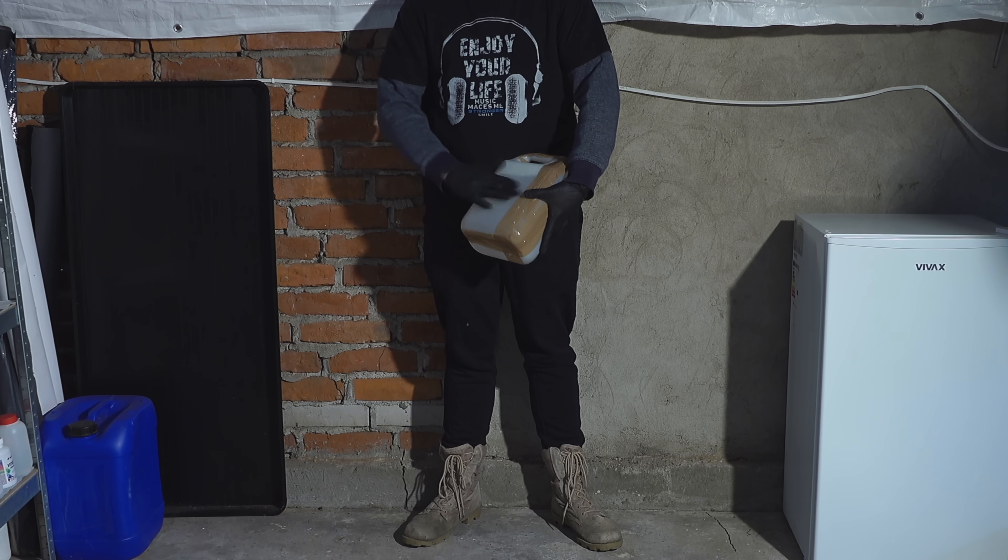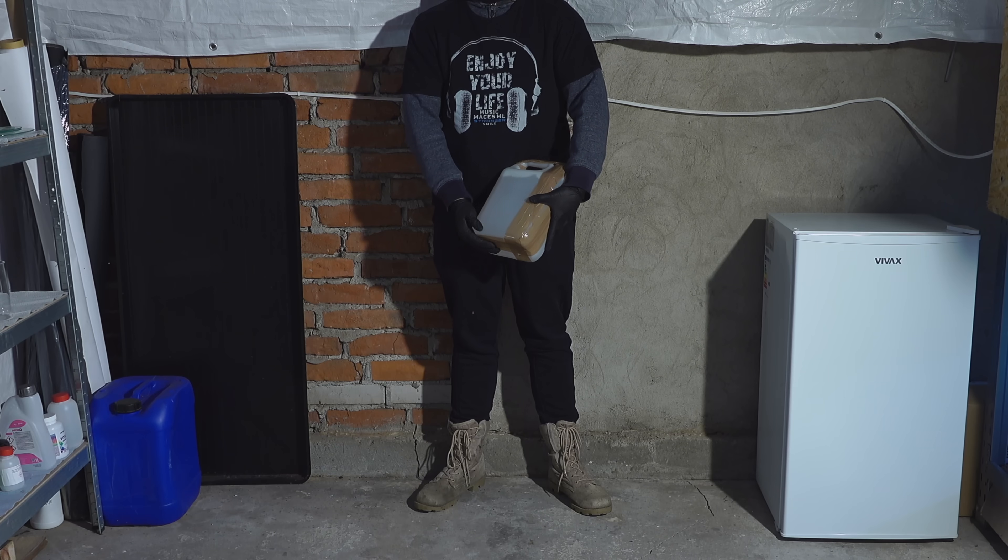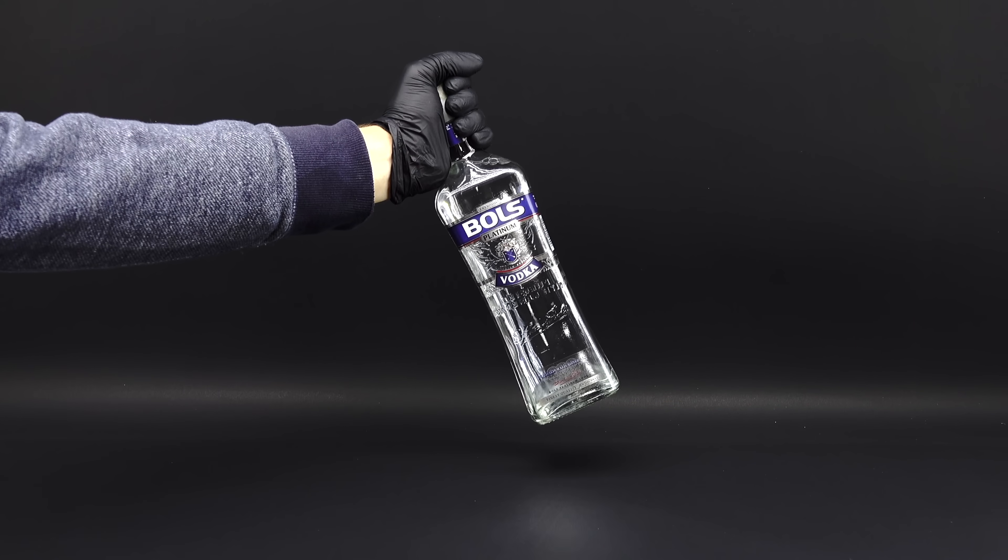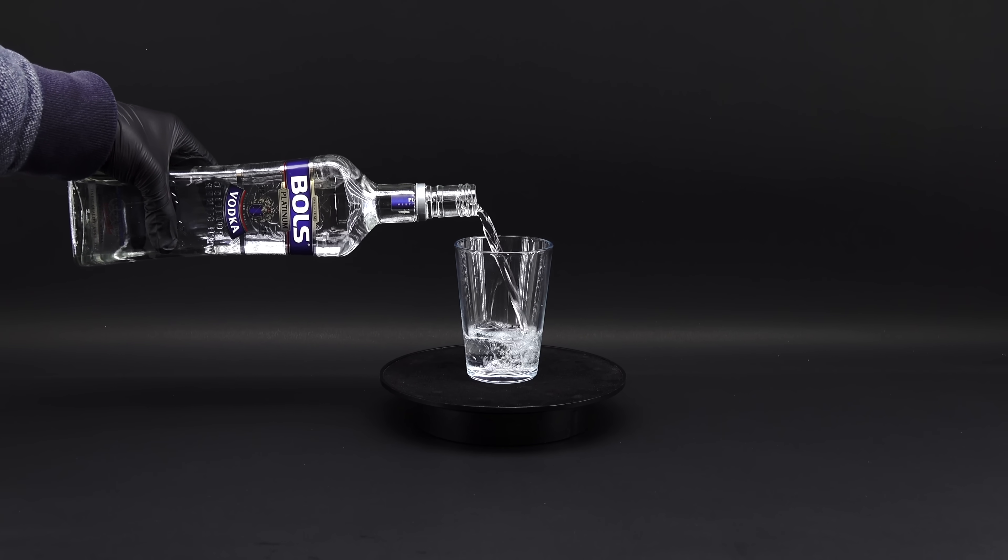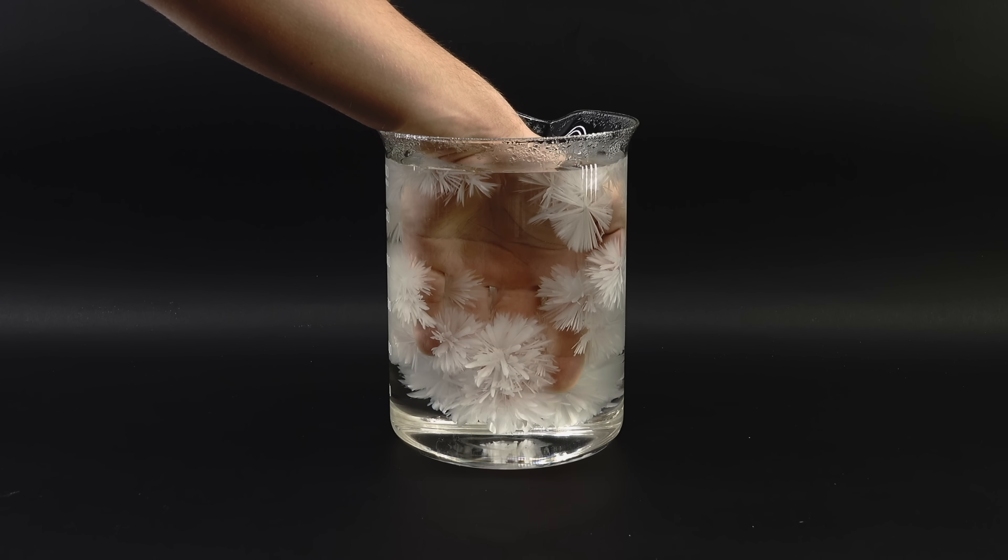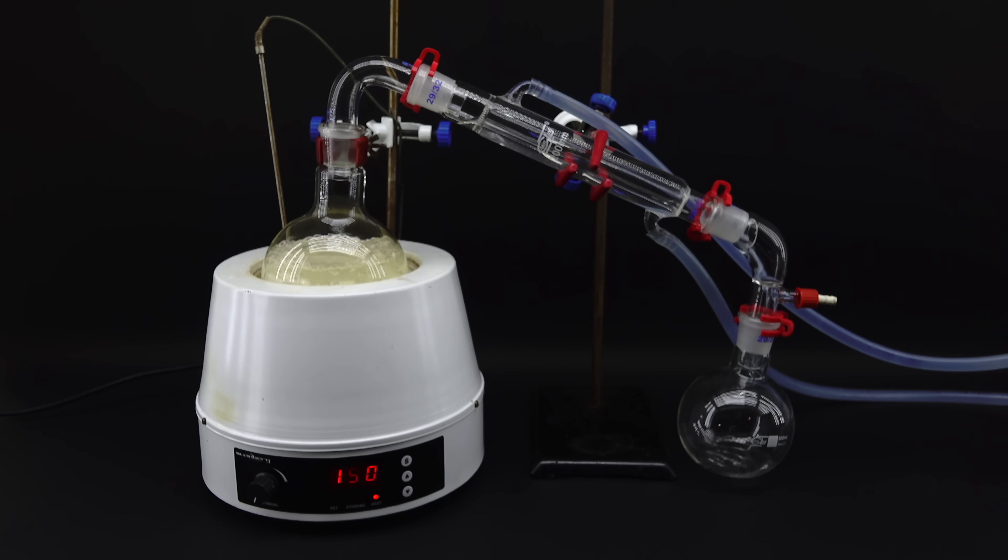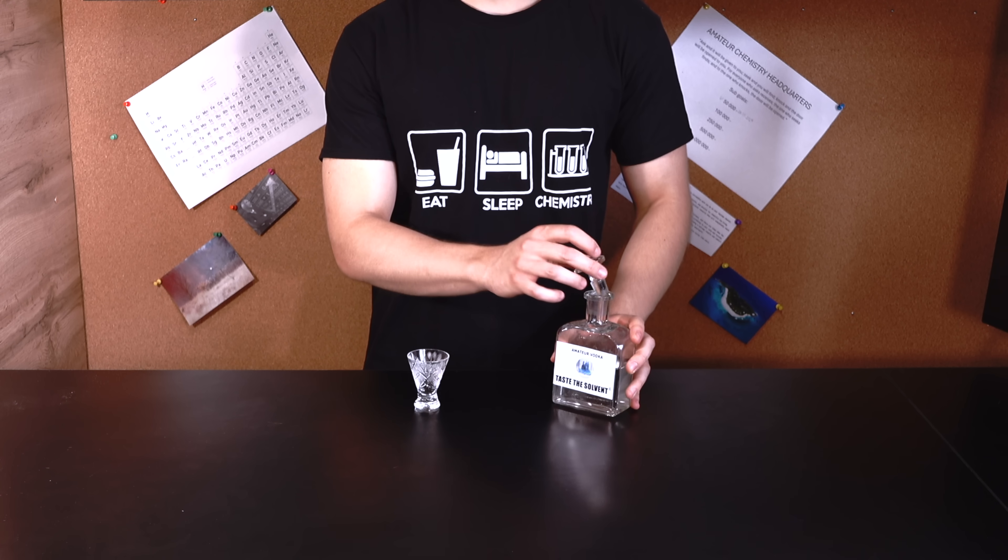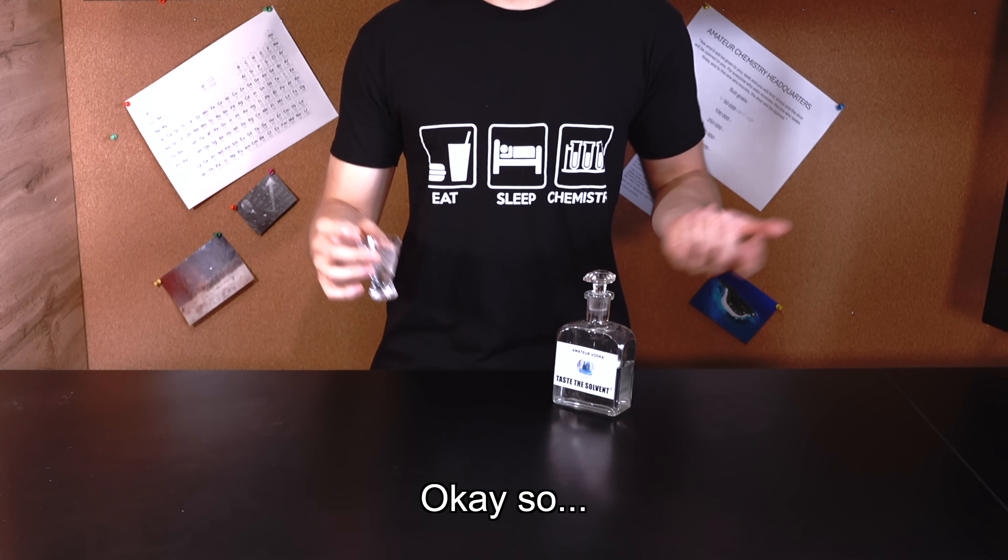This is 5 liters of nail polish remover, and I am about to turn it into real vodka. It isn't nearly as simple as it may seem, and when starting this project, I never expected just how much pain, effort and determination it would take to chemically transform this cheap, smelly liquid into one of my country's favorite drinks. Here we go.